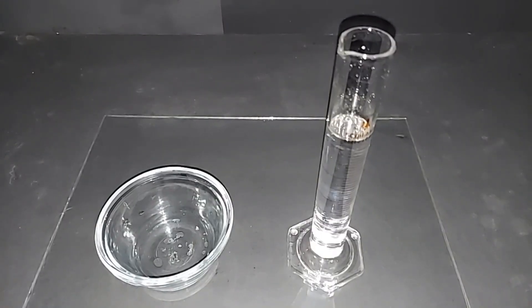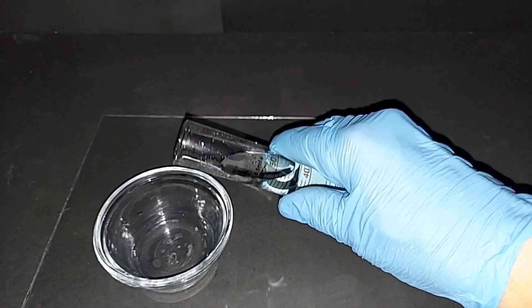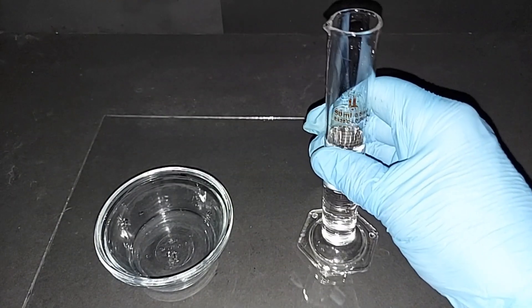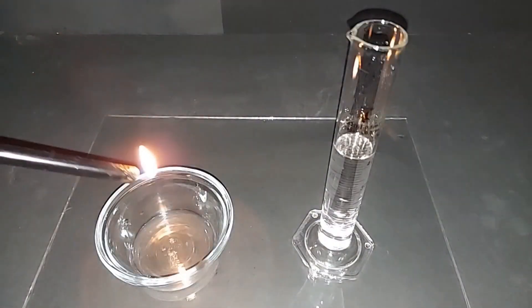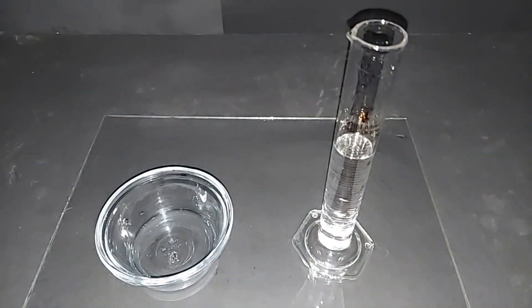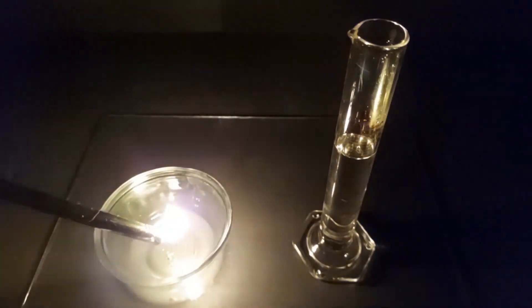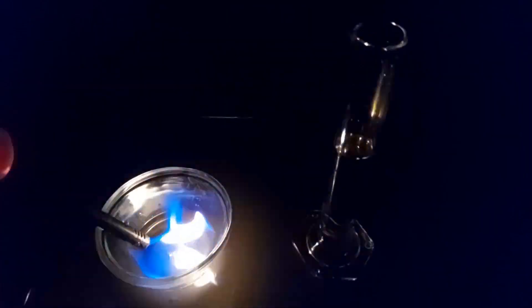The first test for our brand new glacial acetic acid is flammability. I'll pour a little into a shallow glass dish and see what happens. Turning the light off — seems like it wants to ignite. There we go. Wow, look at that blue flame!